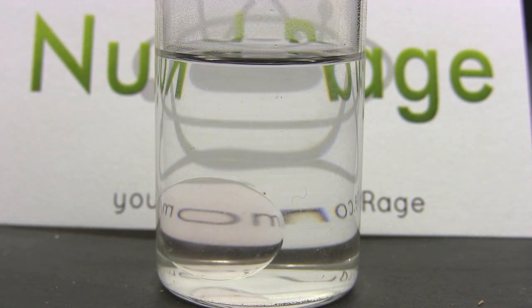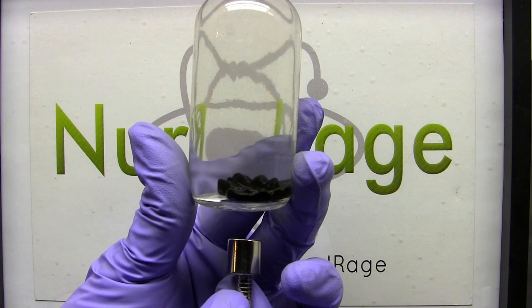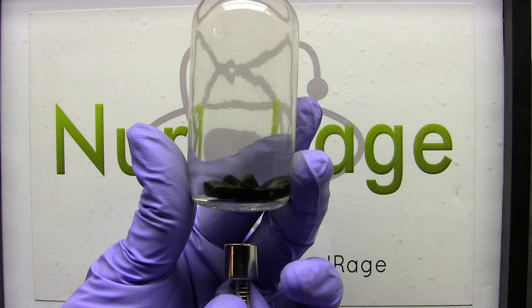However, it does possess the property of being transparent, which almost all ferrofluid lacks. It's also somewhat easier to make.